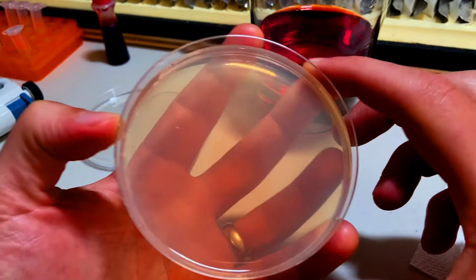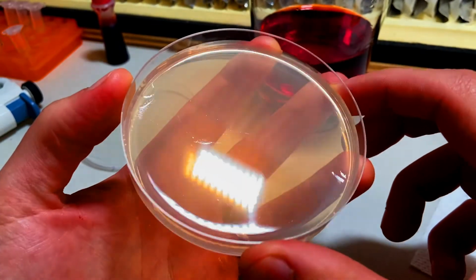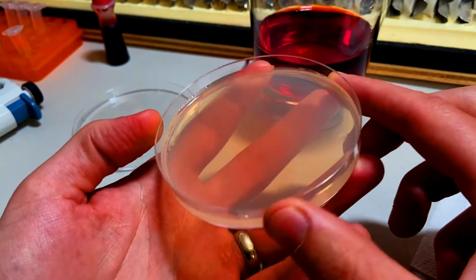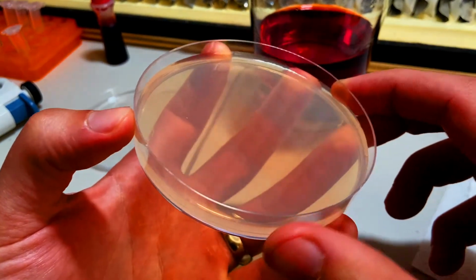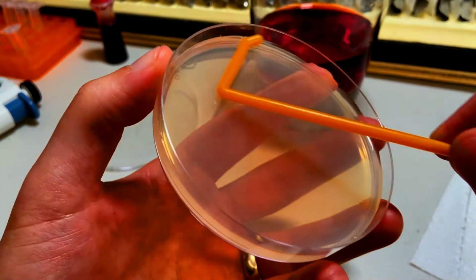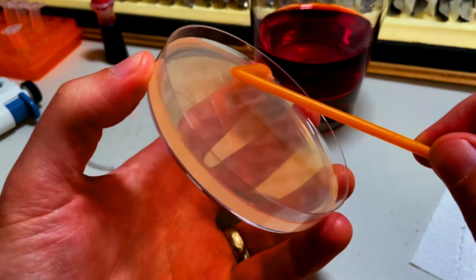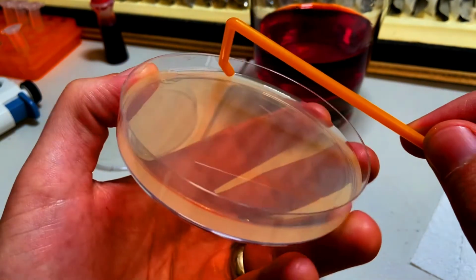I'm trying to think what have I learned from this little experiment? Well, one, try to spread as quickly as possible so that there's less time for it to just soak into one particular area. Two is I think no matter what, it's going to be really difficult unless you have a high volume of whatever it is that you're spreading to get it up around this outer lip that keeps going up around the edges here.